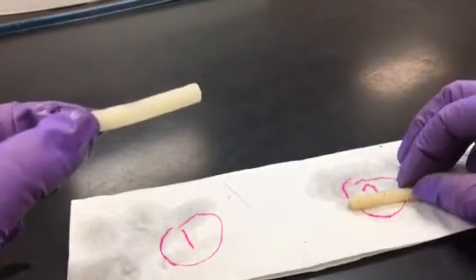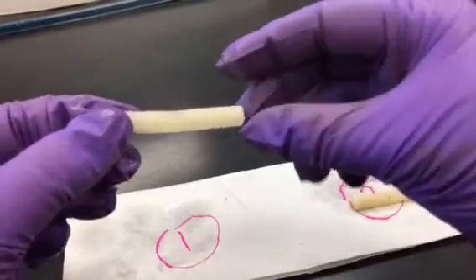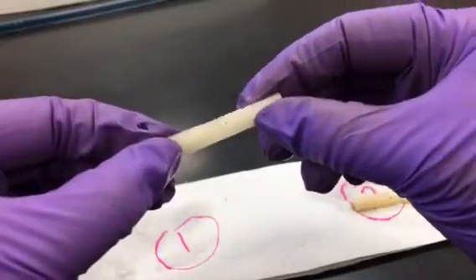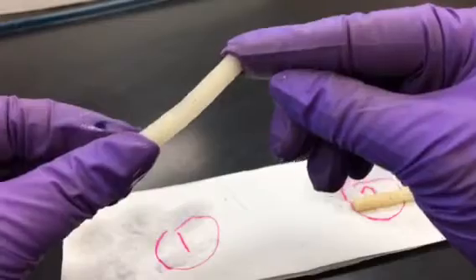In the fresh water, the fresh water provides a hypotonic environment and water will enter the cells. As it enters the cells, the cells swell and push against each other, making the column of cells very stiff.